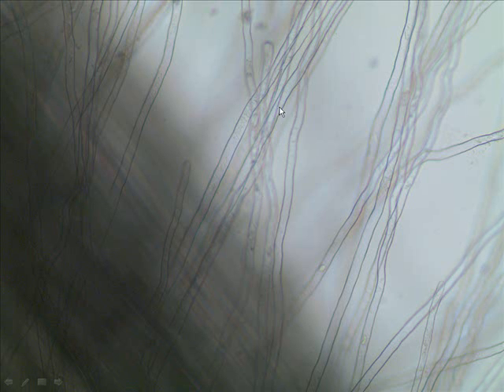Here we are getting even closer. We see no cell walls dividing the root hair. So each root hair happens to be an extension of a particular epidermal cell. One epidermal cell produces one root hair. Not all epidermal cells, but root hairs are extensions of particular specialized epidermal cells, root hairs.